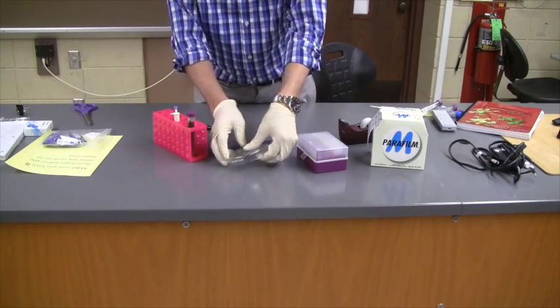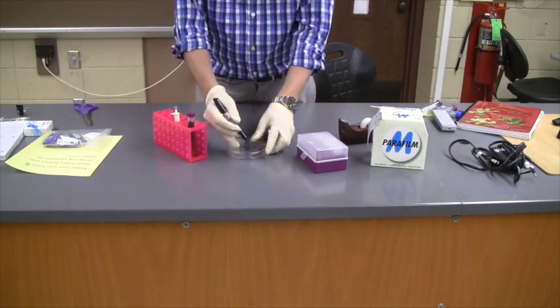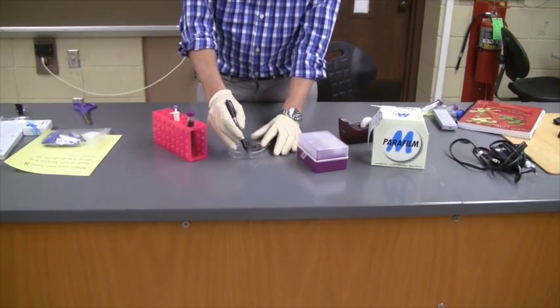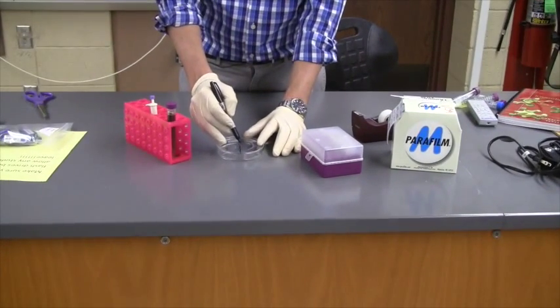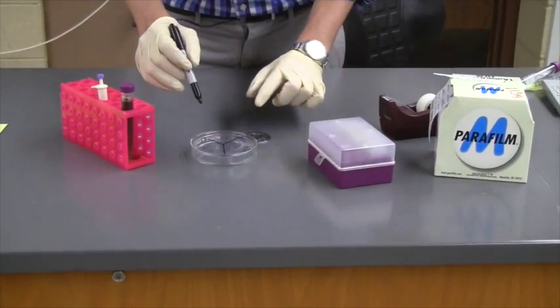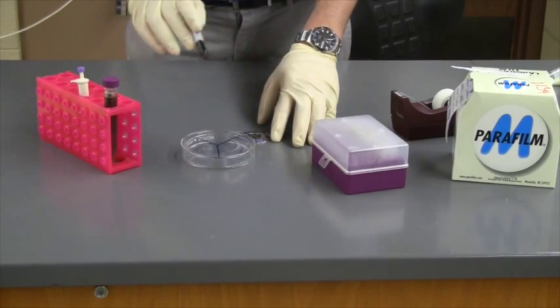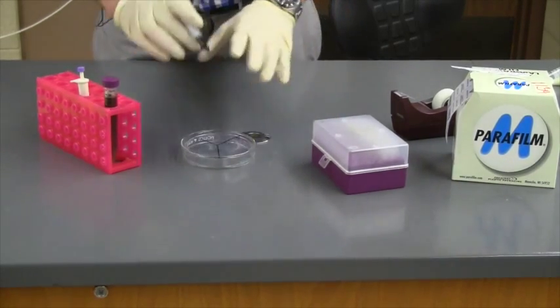One of the first things I'm going to do is take the bottom part and draw the segments for my plate. That way I can say I want to put a certain type of antibiotic over here and a certain type of antibiotic over there and maybe leave one as a control or something like that.